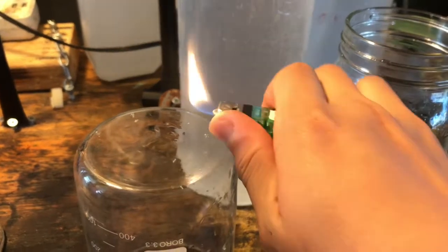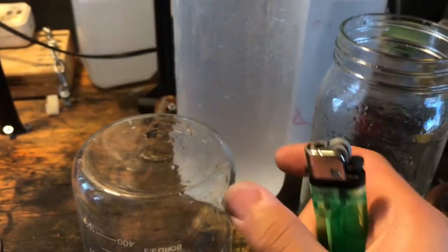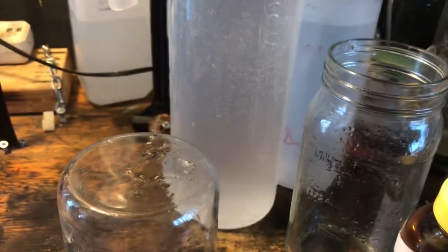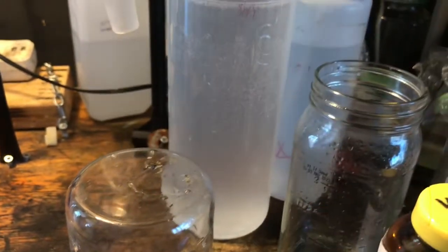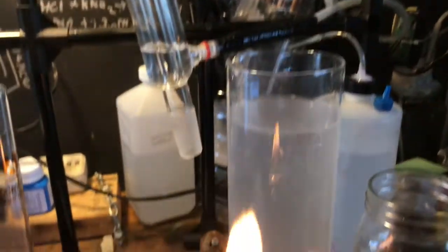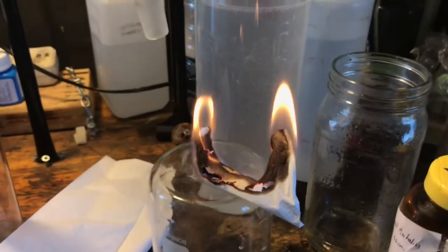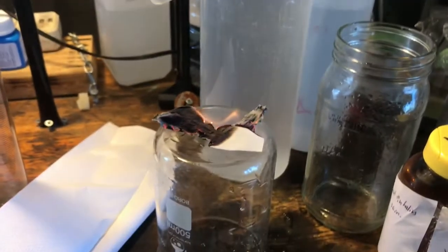As you can see, it's not really flammable by itself. You can hold a flame to it and it ignites and goes out again. This sort of indicates it is something flammable. We can test this further by soaking it onto a wick like paper. As you can see, it burns with a nice aromatic flame with a lot of soot, which shows the presence of something aromatic. So this is definitely xylene, and not just acetone.